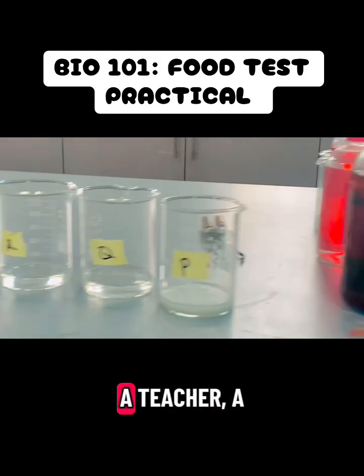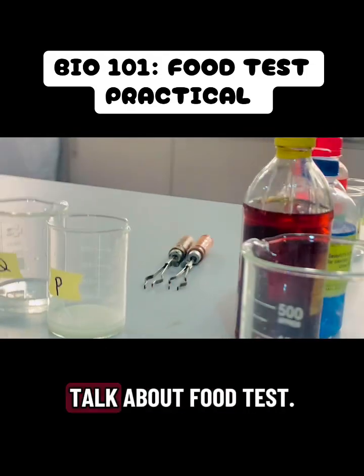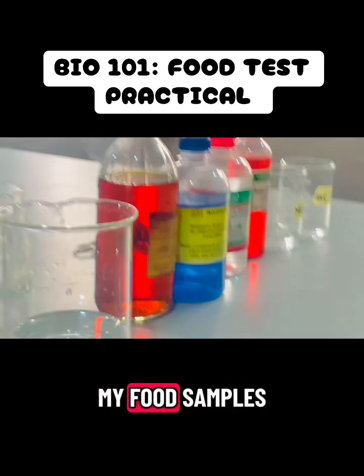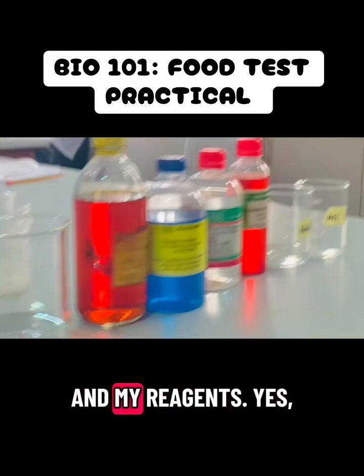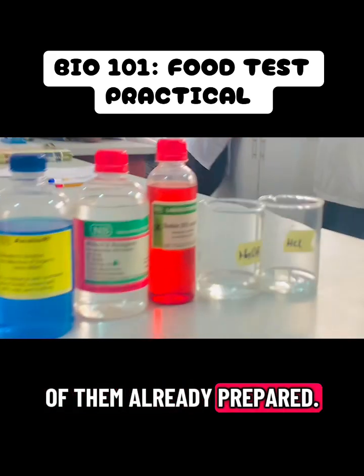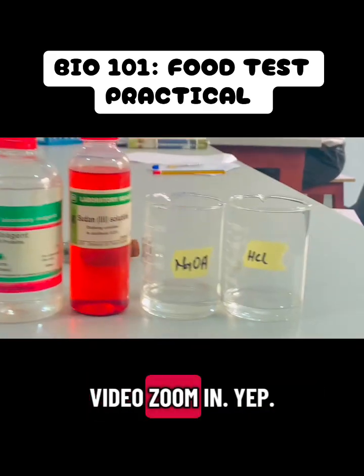So I am a teacher, a biology teacher to be precise. Today we are going to talk about food tests. Yes, you heard that right. These are my food samples and my reagents, all of them already prepared. So let's go into the actual video.